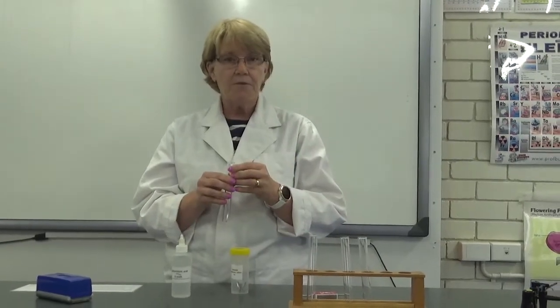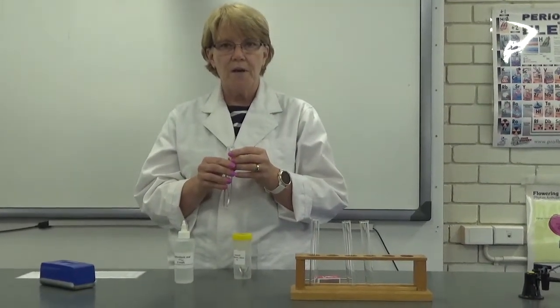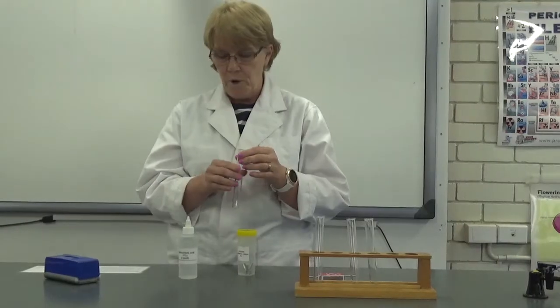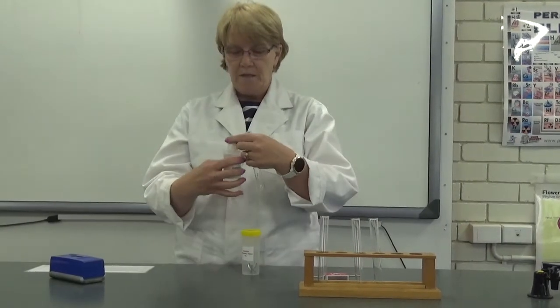So once I've collected that hydrogen, I'm going to test it by the hydrogen gas test, which is called the POP test. Let's have a look.